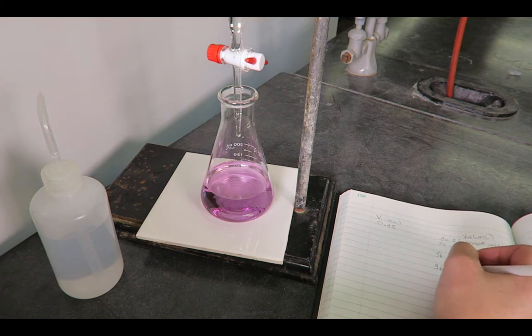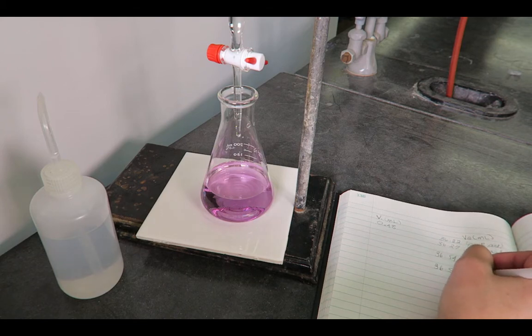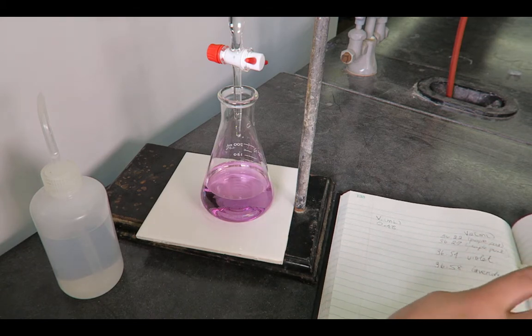When near the endpoint, use the burette reading card to read the burette volume and record the volume and indicator color into your laboratory notebook.